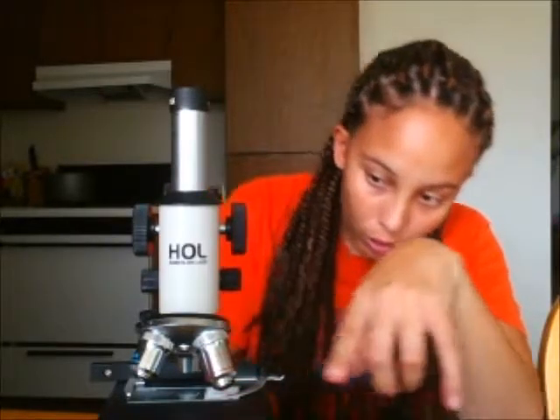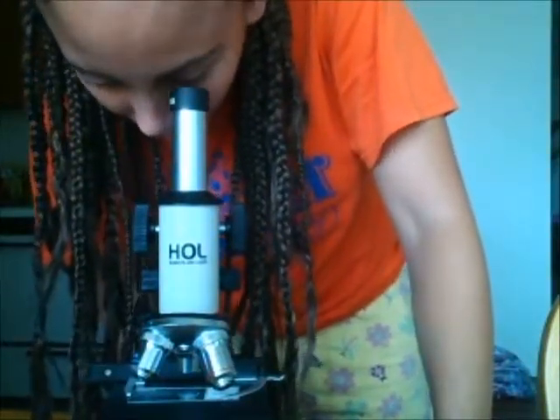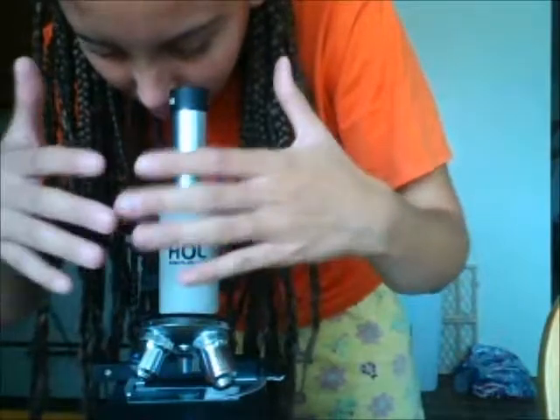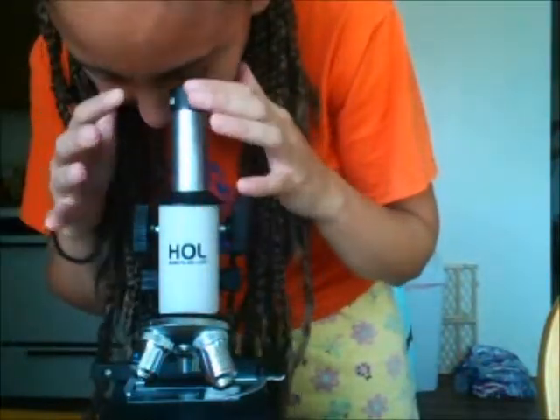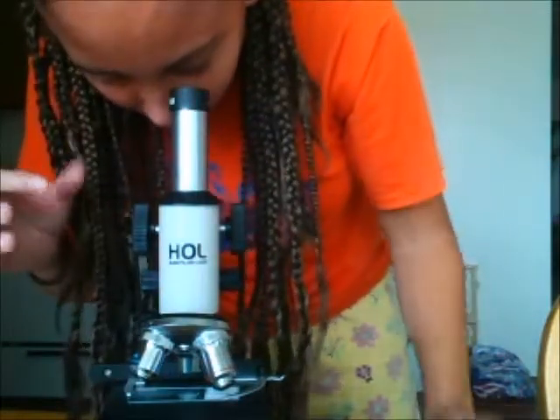Okay, so the next step is taking the letter E slide and observing it in each objective lens, including the immersion oil lens. Right now I have it already in here focused on the lowest power, the 4x, and the observation that I get is it's very clear once you focus in. You can see the clear stuff still around it, so it's not just the E in my ocular lens, and it's just a very clear E, basically making the E on the slide larger for me to view.